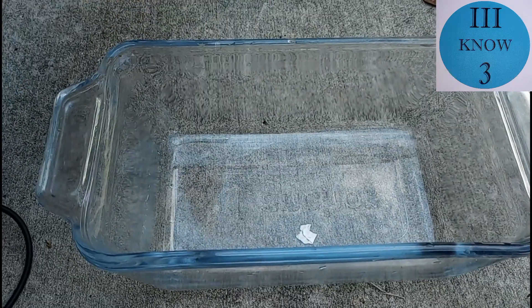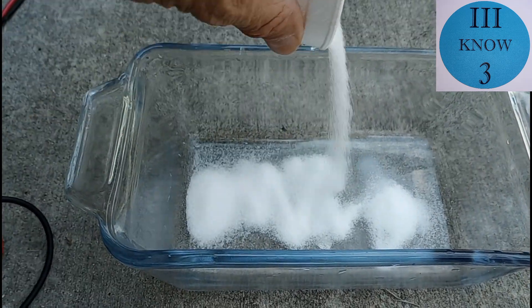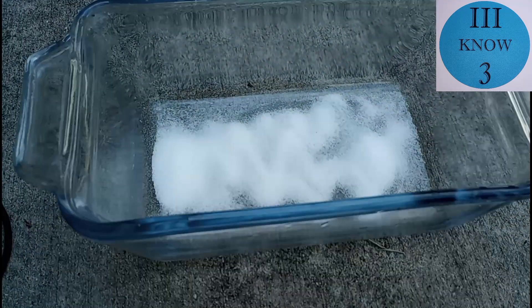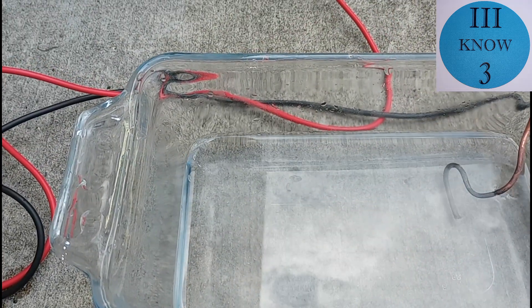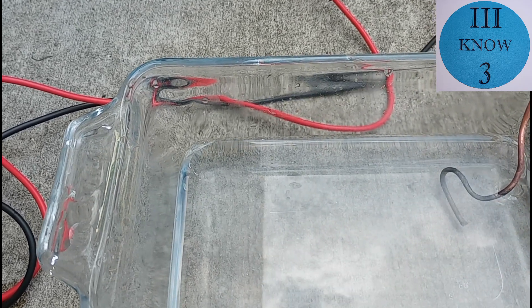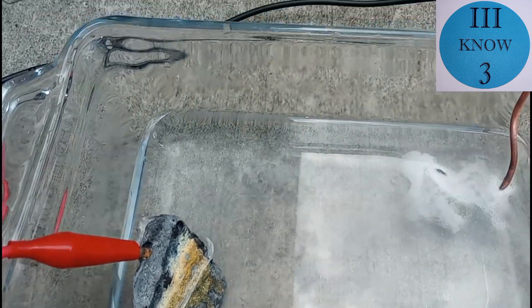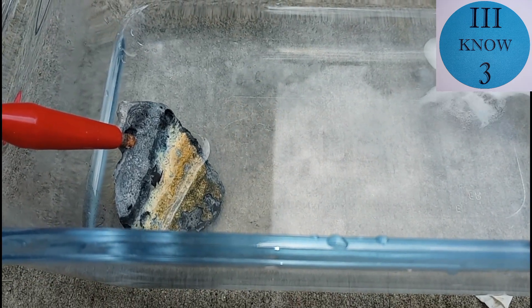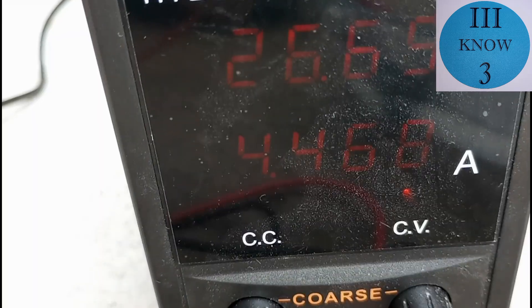So the next day I thought I would try some salt. And this is just standard table salt sodium chloride with no iodine. If you do electrolysis on plain salt water with neutral electrodes, you usually wind up producing chlorine that escapes as gas and sodium hydroxide. But since our anode is going to be the same tin piece that we used before, it should generate some stannous chloride that will take the tin over to the cathode and plate out on our copper wire.